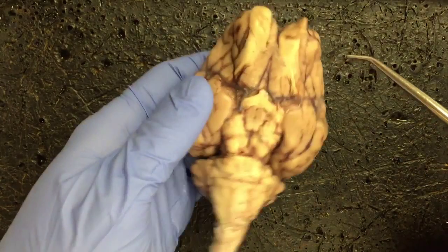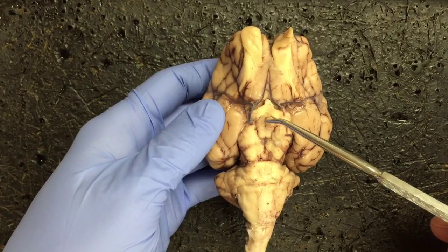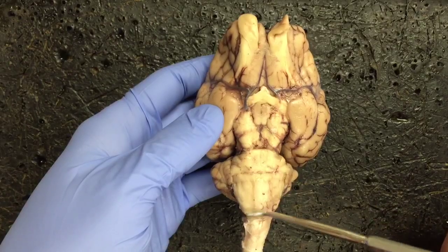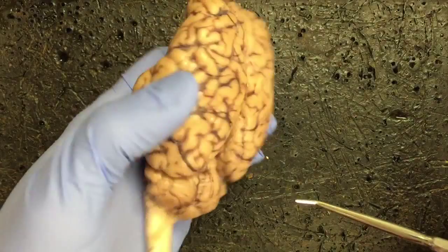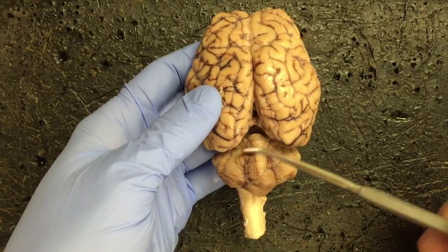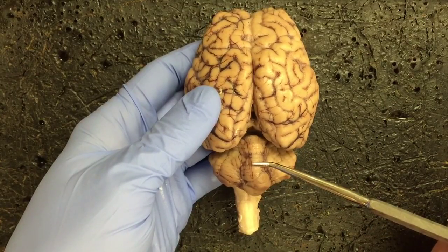Turning back over to the ventral surface, there is a region right here where the pituitary would have attached. That's the infundibulum. The medulla oblongata is this region that is just posterior to where we had the pons. So this area right here would be the medulla oblongata. The cerebrum is a general region of the brain. Remember that it's divided into two major halves, whereas the cerebellum is a single part, and you can see that it is posterior to the cerebrum, and it was named because it looked like a small brain.